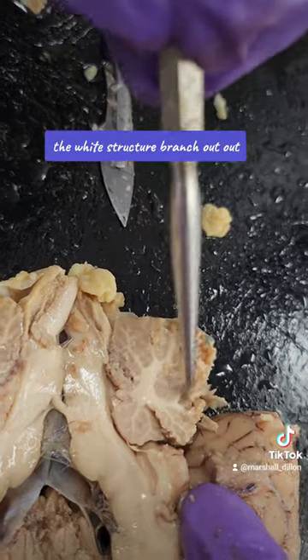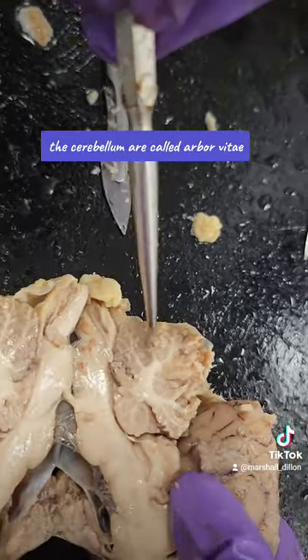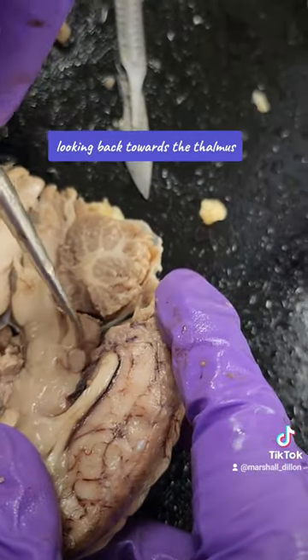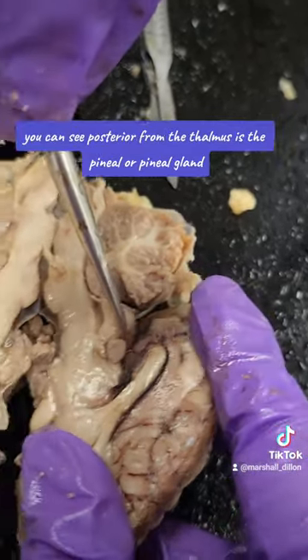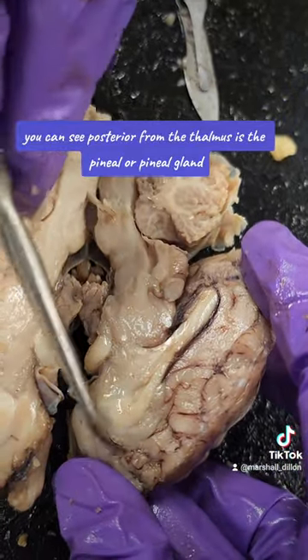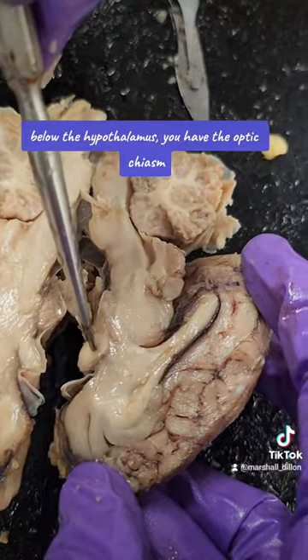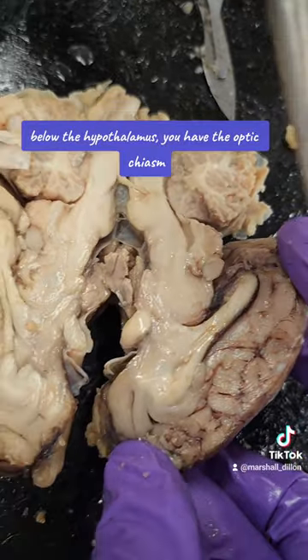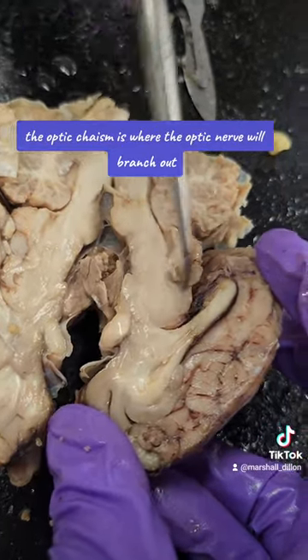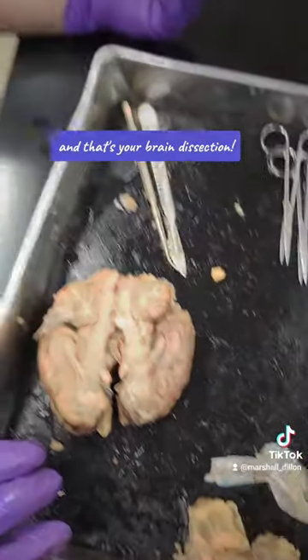The white structures branching throughout the cerebellum are called arborvitae. Looking back towards the thalamus, you can see posterior from the thalamus is the pineal gland. Below the hypothalamus, you have the optic chiasm. The optic chiasm is where the optic nerve will branch out, and that's your brain dissection.